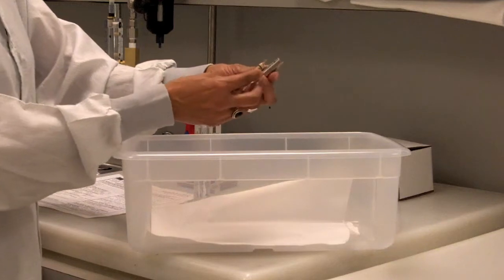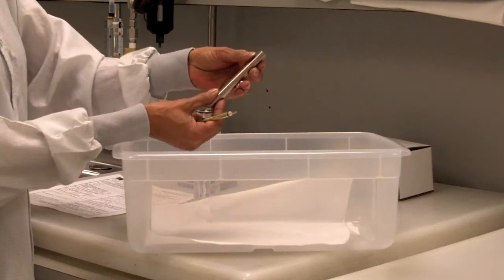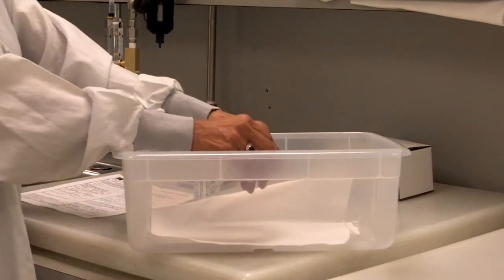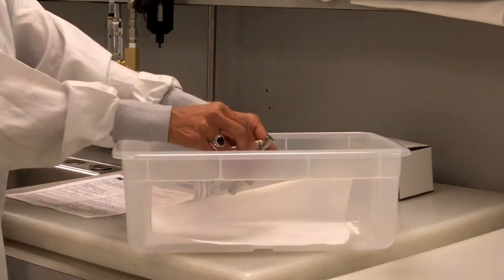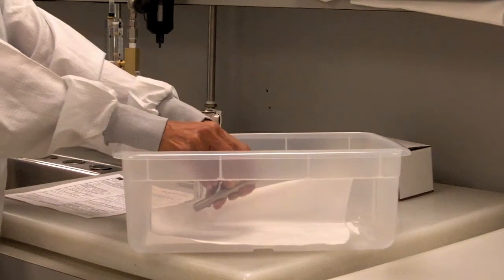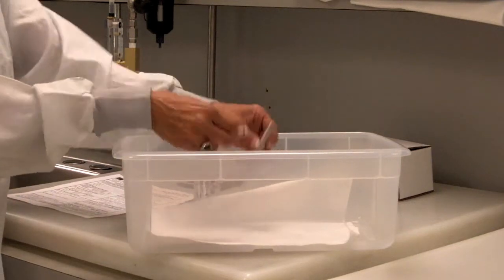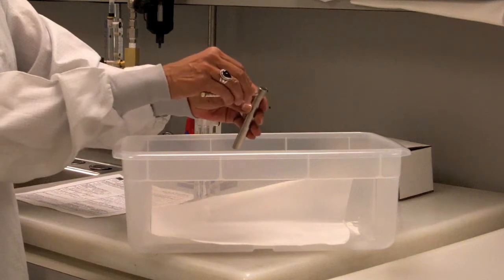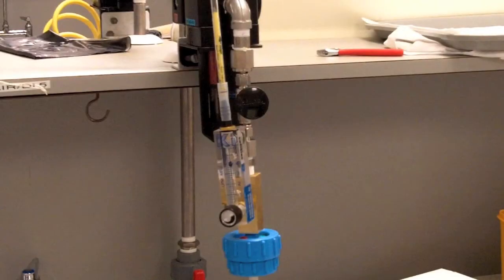Insert the tip of the tube into the smaller of the 2 holes of the tip breaker and apply sideways pressure until the tip breaks. Break both tips of the detector tube. Please use caution when breaking tips, inserting the tube into the tube flow meter, and handling the tube.